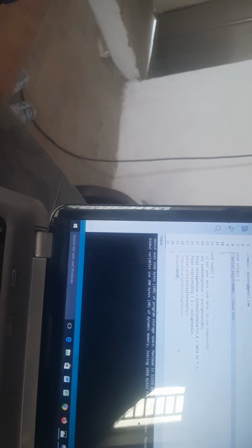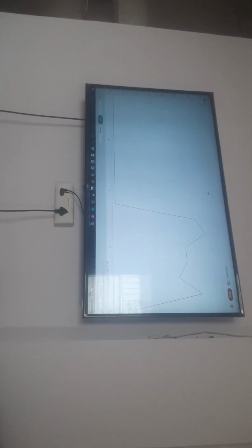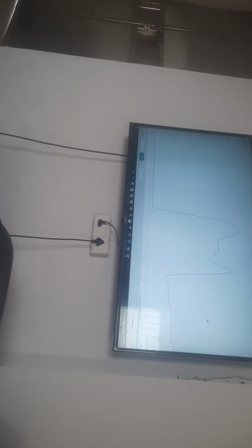So instead of keeping the delay to be 10,000 milliseconds, let me put it as only 1,000 milliseconds so that we get more data points. So now I verify it, and then I upload the script, and that has happened successfully. And then let me see the plotted data, and now I can see that a straight line has been generated. Let me make it full screen. And then if I put in the opaque substance, the light glows and the data also changes. And the good thing is that if I click on the interpolate thing, we get much nicer curved plots instead of straight lines, as you can see over here.